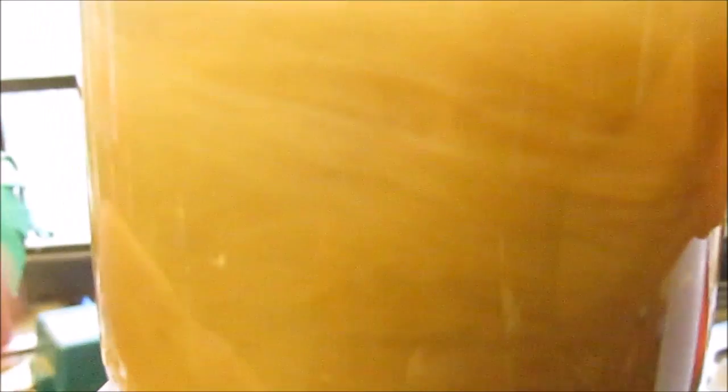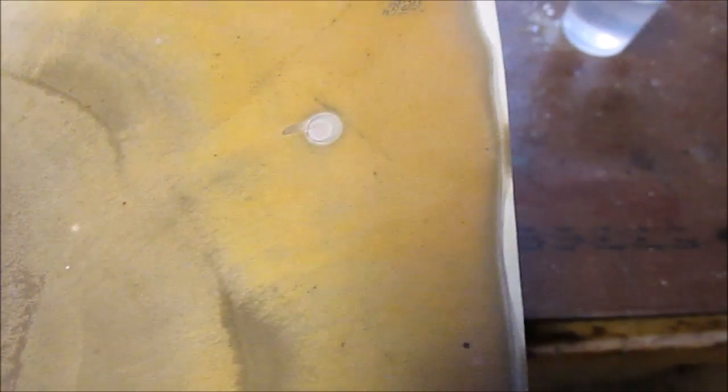The darker colors down there are the silver oxidizing. I am very pleased with this — it looks like the skies of Jupiter. Also of note, this copper hydroxide and copper oxide filter I left out a few days ago — the copper has precipitated out of it into extremely fine powder, and that's what's causing this gold-like, honestly copper color to form on my filter paper. That's very pretty.